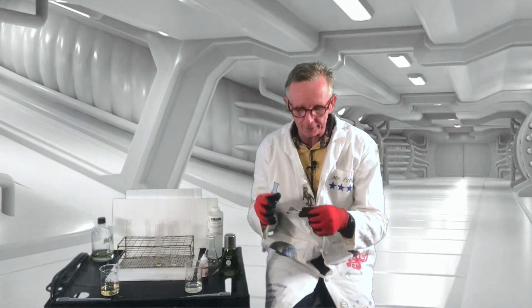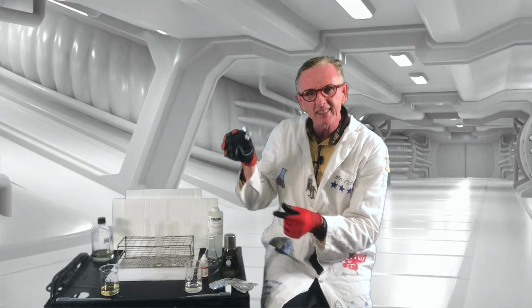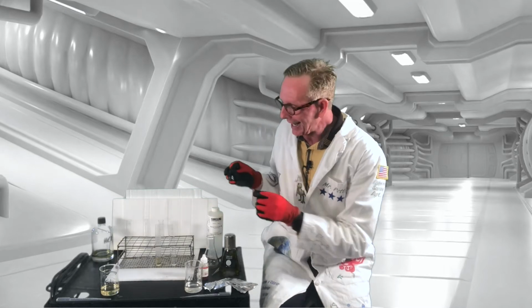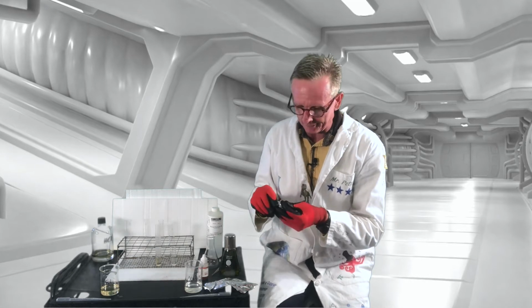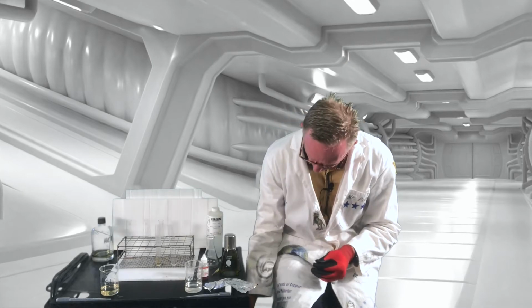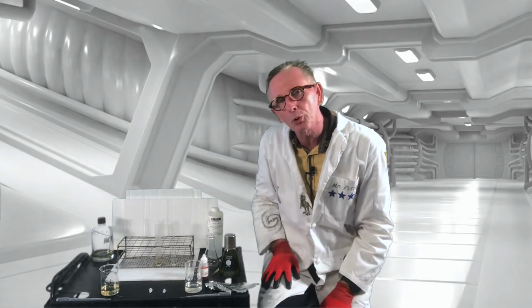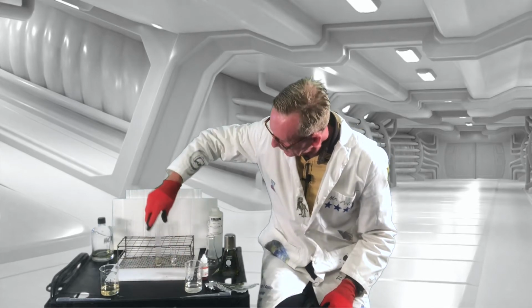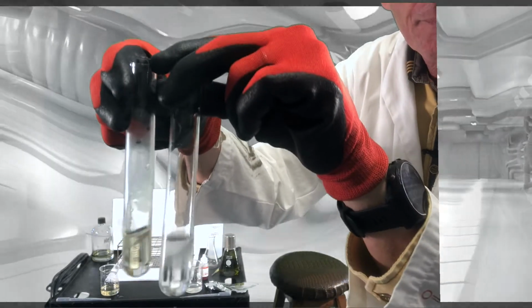Now we are just going to see what happens if they are exposed to something as simple as tin foil. Now I'm going to get these kind of ready, just a small piece each. I'm going to drop them in there, and I'll try and bring them up to the camera, and we'll time lapse this to see what happens. So I just get these sort of equally crumpled up. Now, here we go, our two little pieces. I'm going to drop them in, I'll bring them up, we'll time lapse it and see what happens. So one in the sodium hydroxide, one in hydrochloric acid, and here we go.